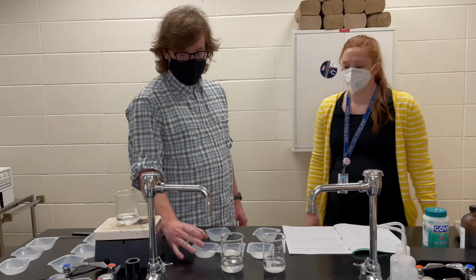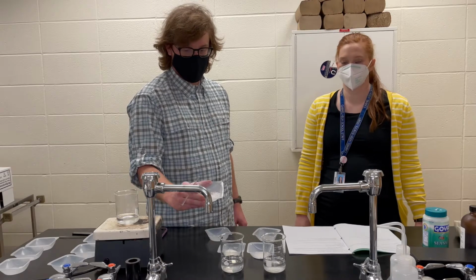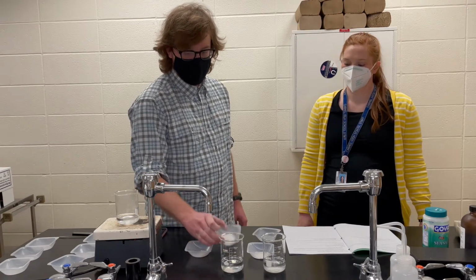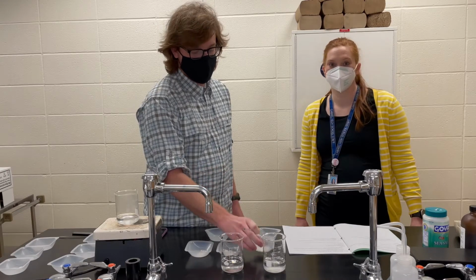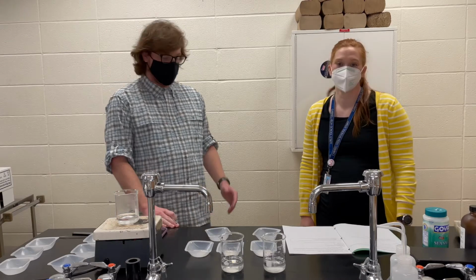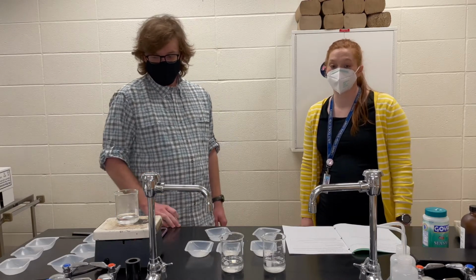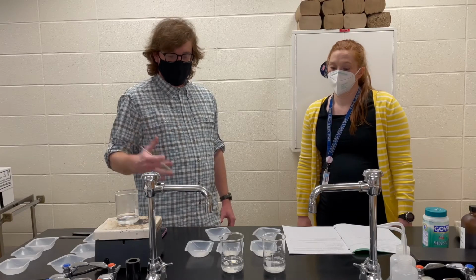In the lab, we'll be looking at a couple different kinds, so let us just show you those at the top. We've got some larger salt crystals, some medium-sized salt crystals, and then some small salt crystals. These are all just sodium chloride, so what you know as salt. So the chemical makeup is the same, but the size of the crystal is different.